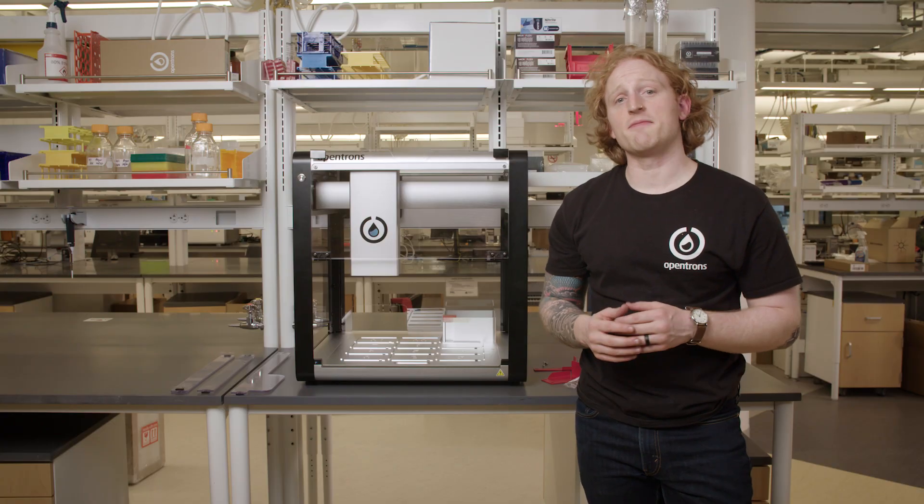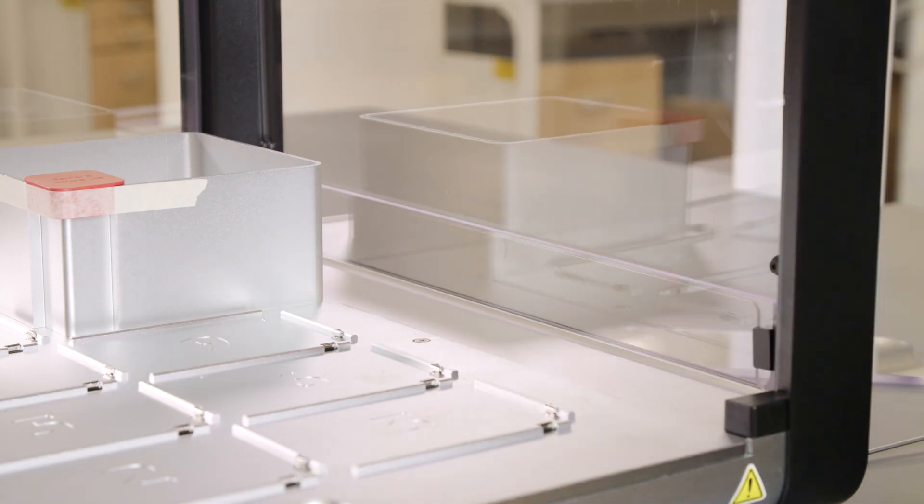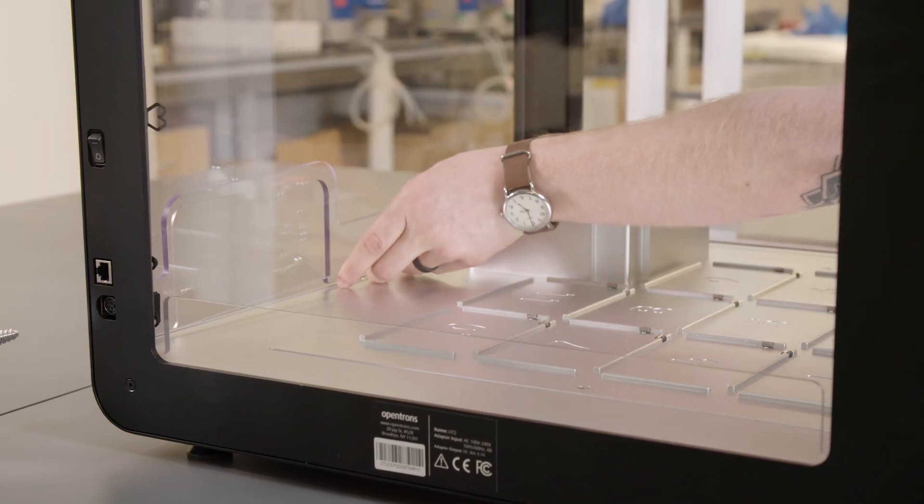The side panels have magnets on them and snap onto the pre-installed screws that hold the side windows in place.